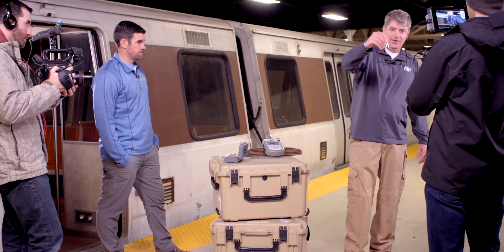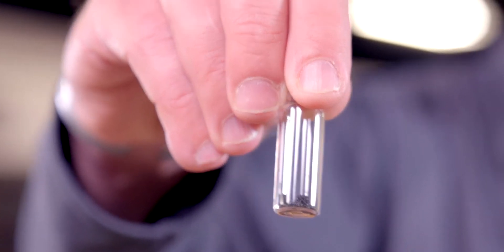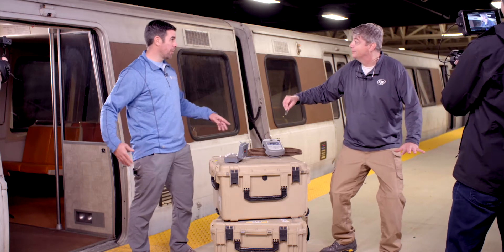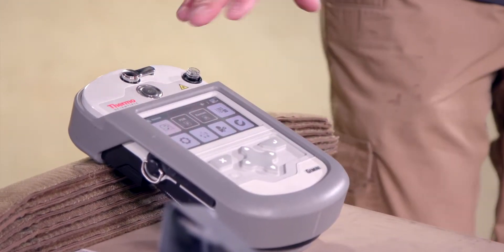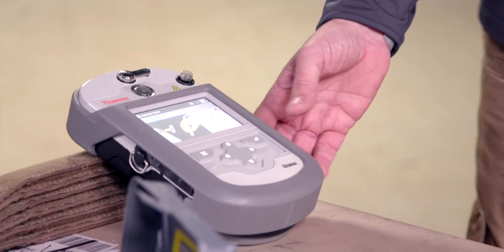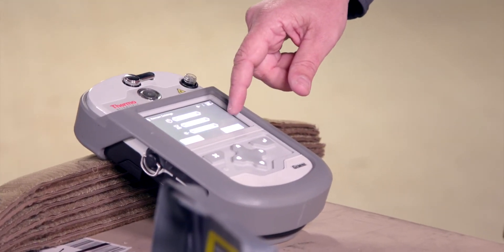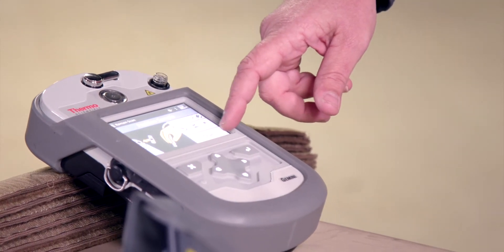I'm going to put this amount of an unknown substance into the Gemini. So we're going to put this unknown material in the Gemini. We're in vial mode here, using Raman, not FTIR obviously. We're going to select Raman. I'm going to give myself a 15-second scan delay to give me a little bit of time to walk away from this thing, and I'm going to hit scan.